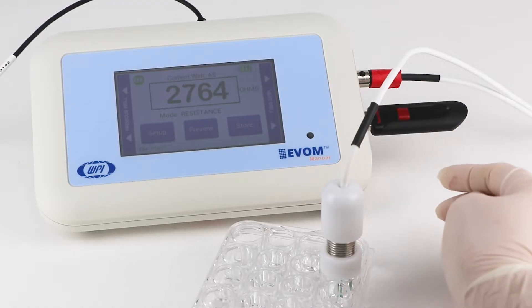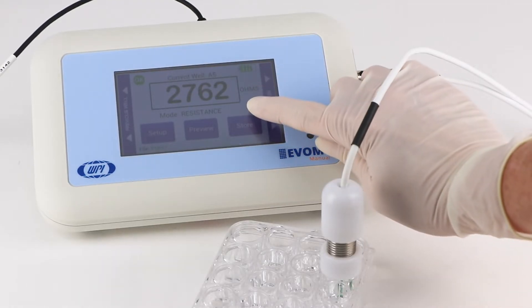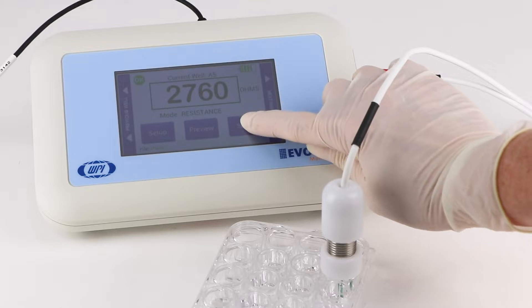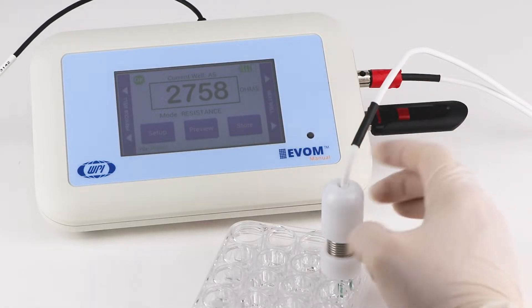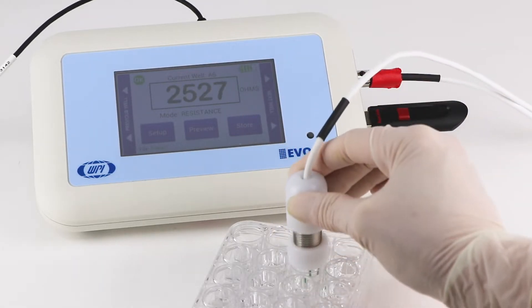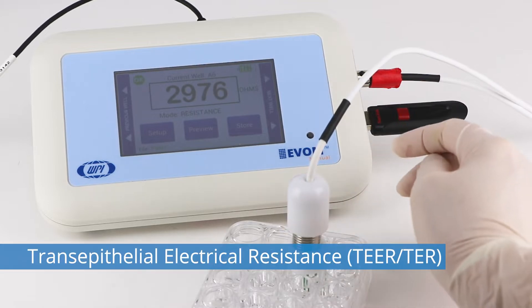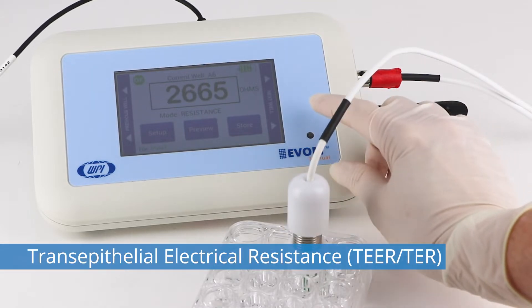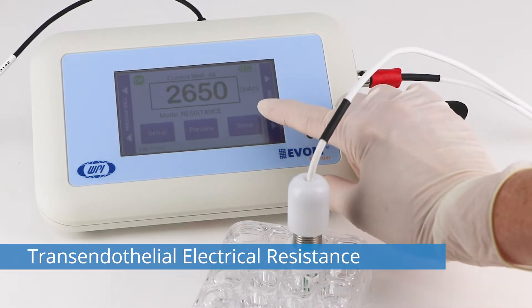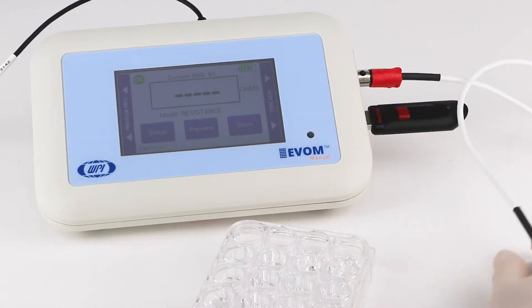WPI's EVOM system is popular in the research community, both in academia and in industry, and it's commonly used for the evaluation of mammalian cellular health by measuring transepithelial or transendothelial electrical resistance of cellular layers.